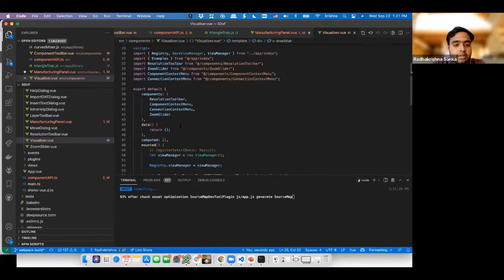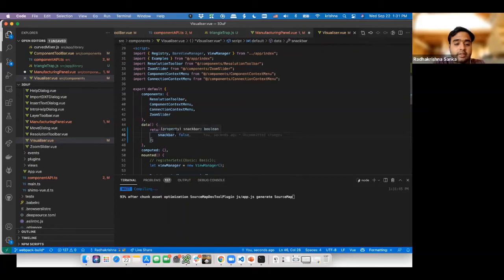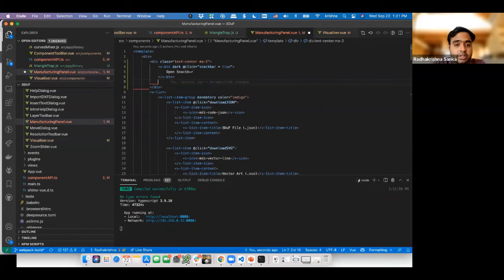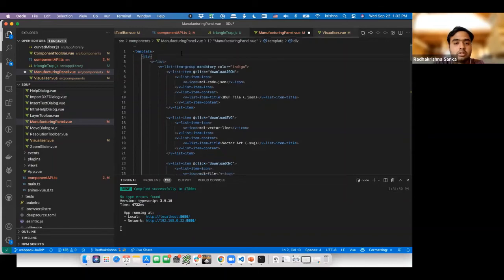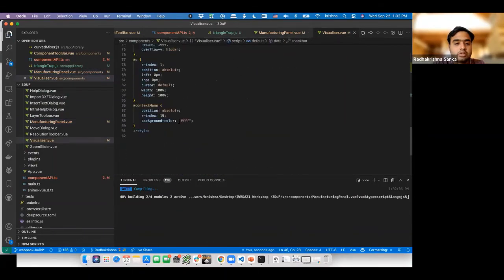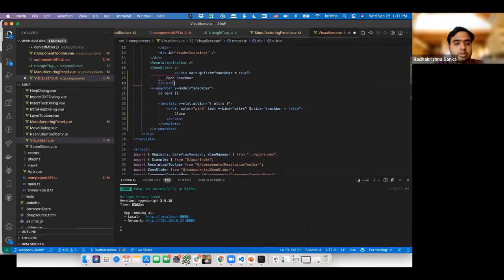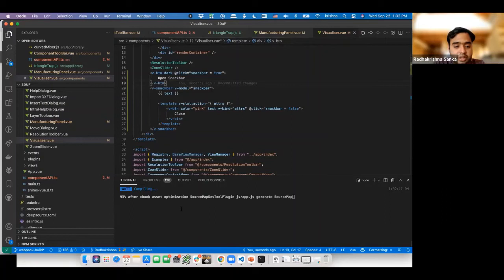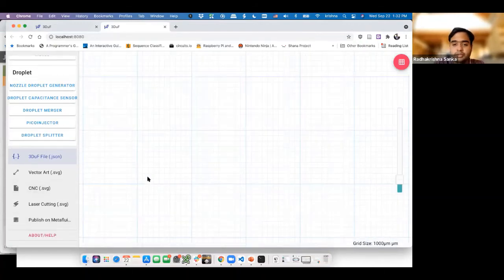And I'm going to add another thing in here called snack bar, and I'll set it to false. So this way, I'm also going to move the button because it's just easier to demonstrate. So when I put it over here, let's see where it pops up on our visualizer screen. Well, I am not sure where it's popping up for some reason.